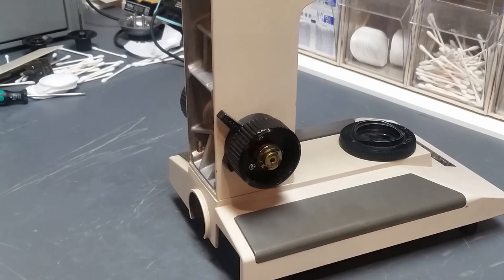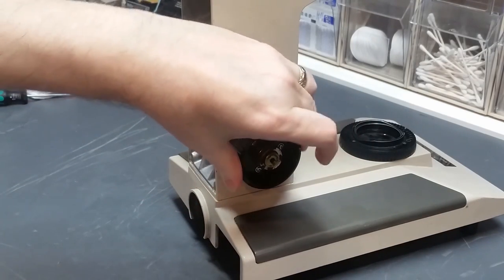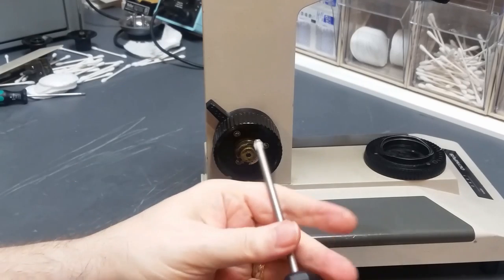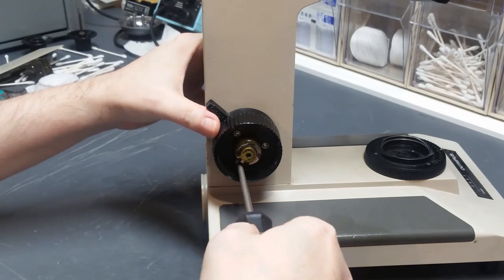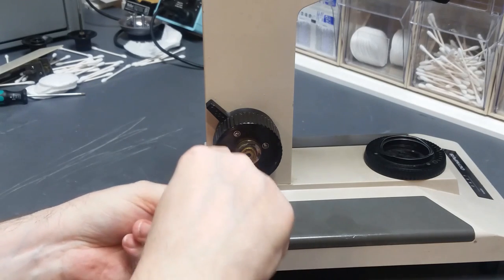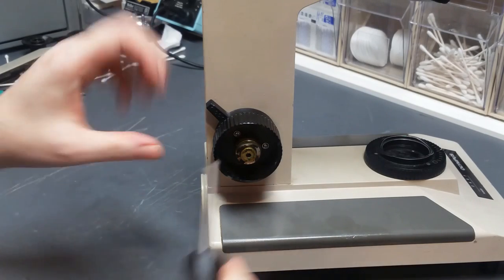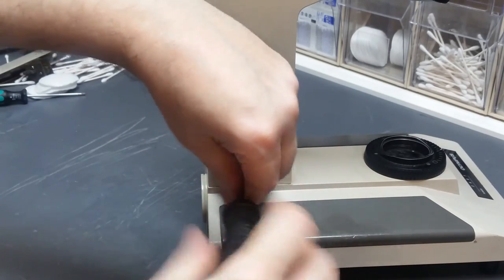Okay, now that the fine focus knobs have been removed, the next step is to remove the coarse focus knob on this side of the scope. And in order to do that, you need to make sure you have a good JIS screwdriver that fits these heads perfectly, otherwise they'll slip and you'll never get them out without a drill. That one came out pretty well. Loosened up.